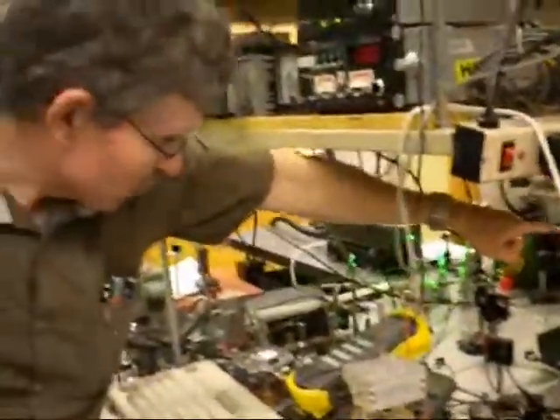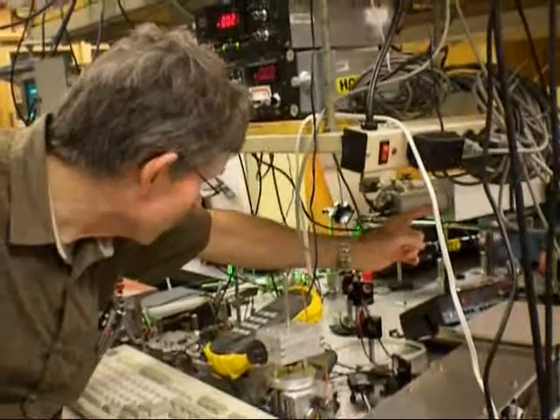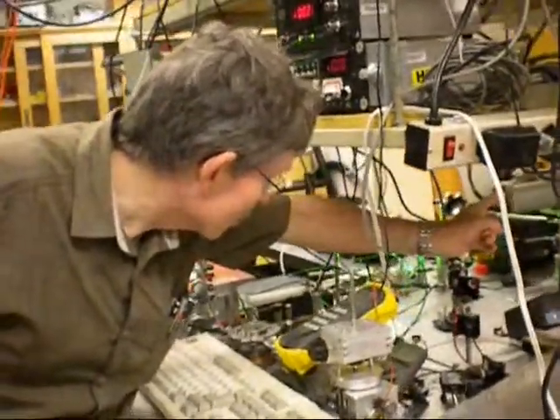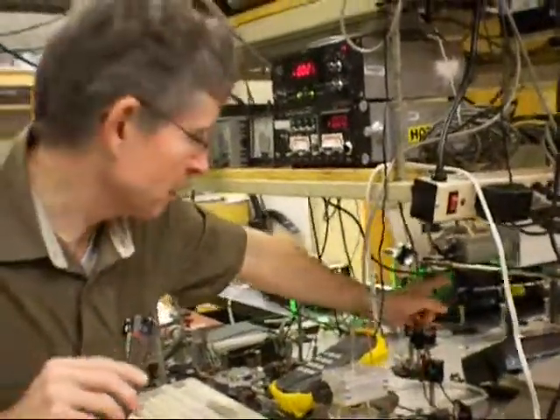In any case, let me switch its modulator on. The portion of the beam goes onto this light. There's mirrors onto the monochromator that's over there. Is that sufficient for you? Yeah.